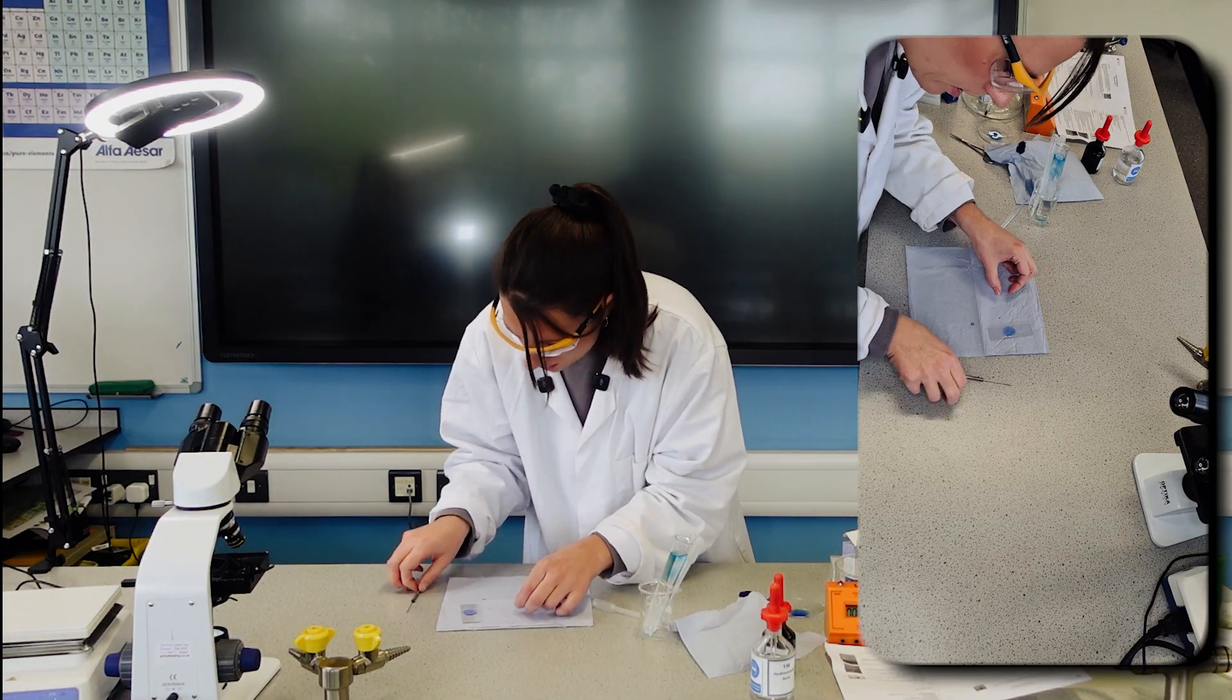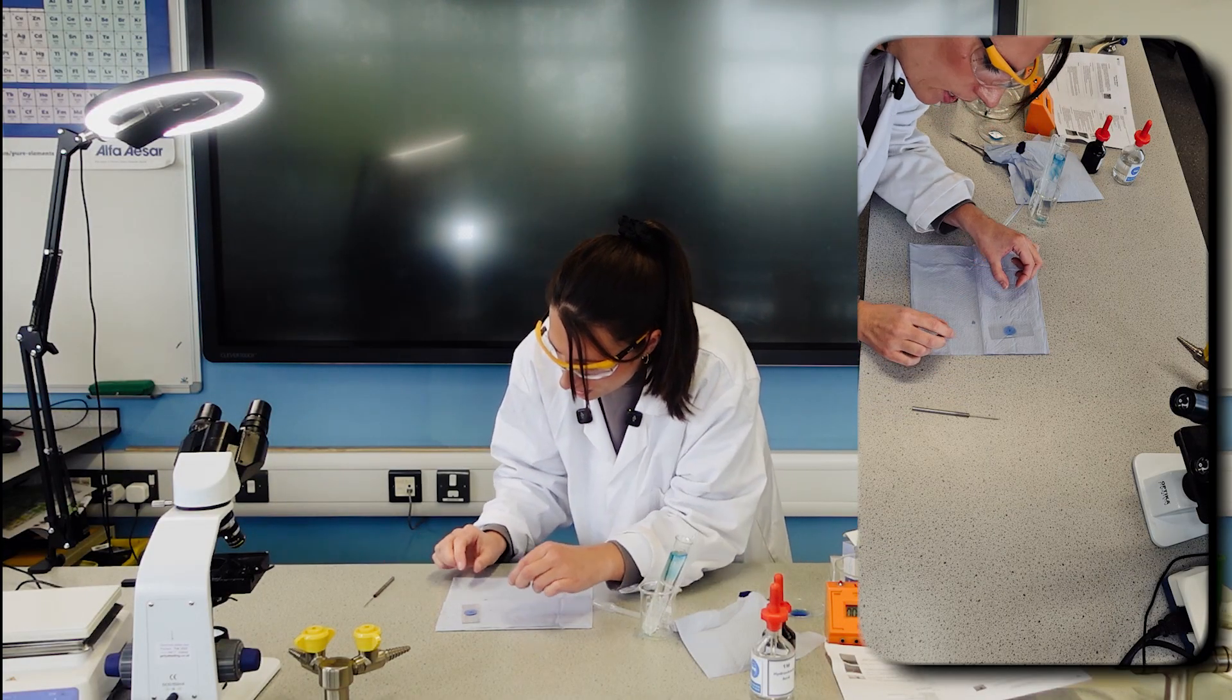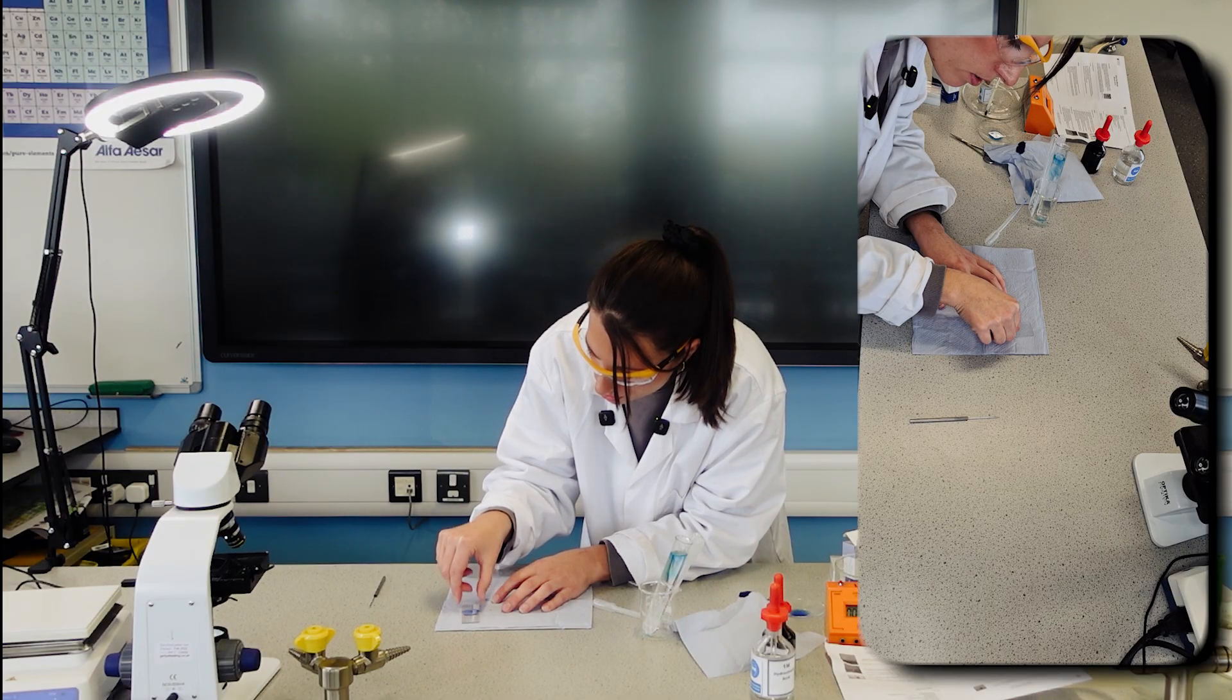I can see I'm going to move this, this is like my main root tip I'm going to aim to see. Use my mounted needles, position it out there.